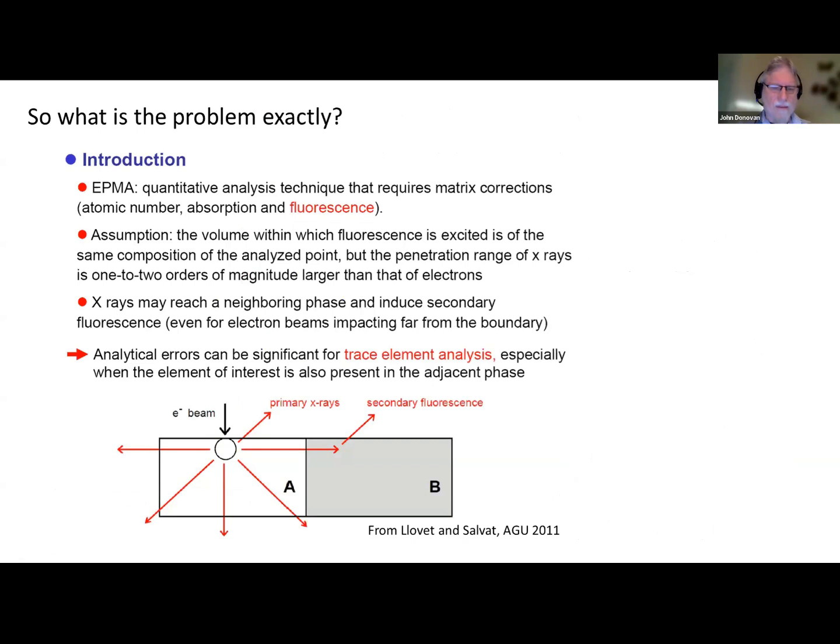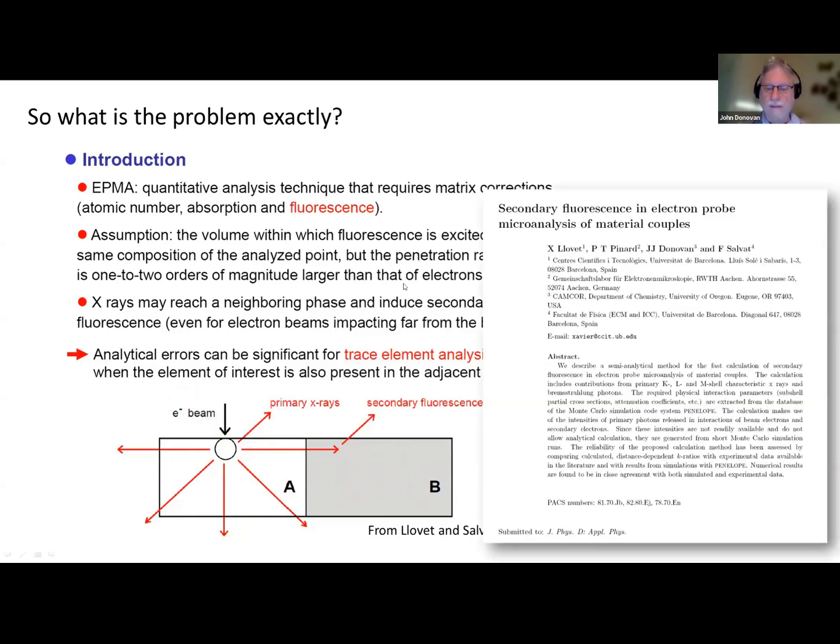Okay, so what's going on? The important point is that you can have a beam incident on a material. Your electron beam comes in and the electrons are in an interaction volume, but the X-rays, including the characteristic X-rays but also the continuum X-rays, go in all directions, isotropically. If you happen to be near another phase, what we call the boundary phase, then you can get secondary fluorescence emitted from that material. One of the early papers on this was published a few years back, and it has all the physics details, but I'm not going to get into the physics details too much.